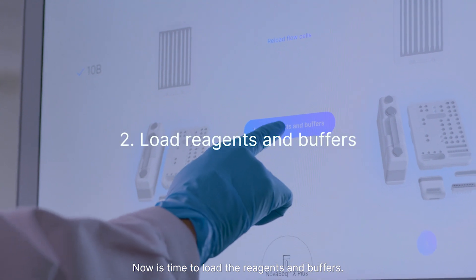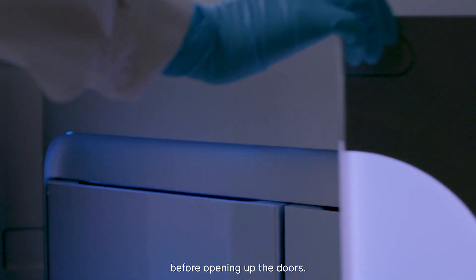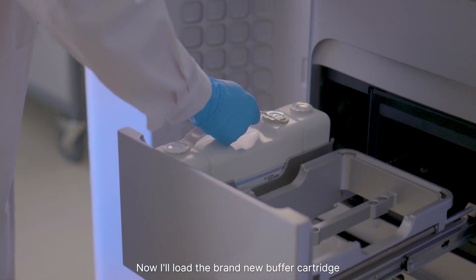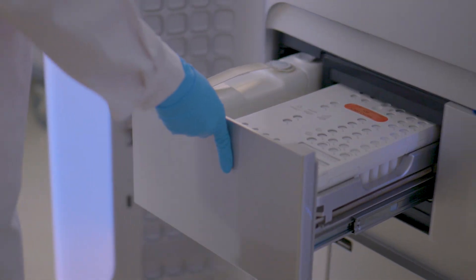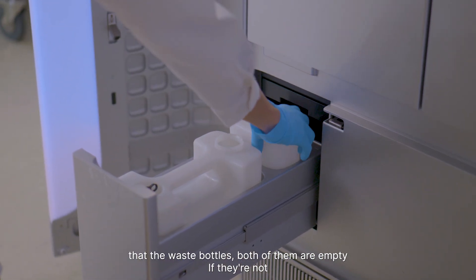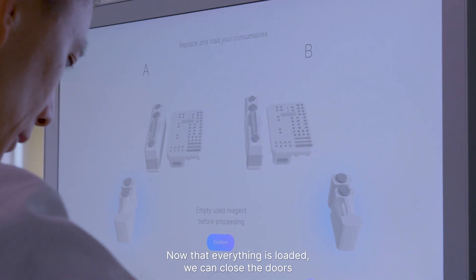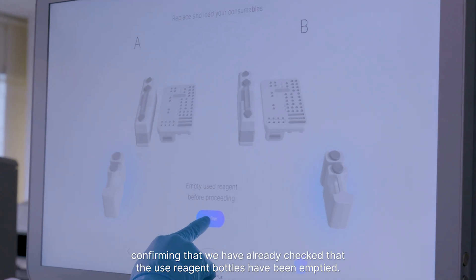Now it's time to load the reagents and buffers. The NovaSeq X Plus is placing the consumables in a safe state before opening the doors. We'll open up the doors all the way and pull up the drawer. First, remove the used buffer cartridge and wash cartridge. Now load the brand new buffer cartridge, followed by the reagent cartridge we prepared earlier. We are done with Site A. It's also good to open up the waste drawers and make sure that both waste bottles are empty. If they're not, please dispose of the hazardous waste into the hazardous waste container in your lab. We'll do the same thing with Site B. Now that everything is loaded, we can close the doors.